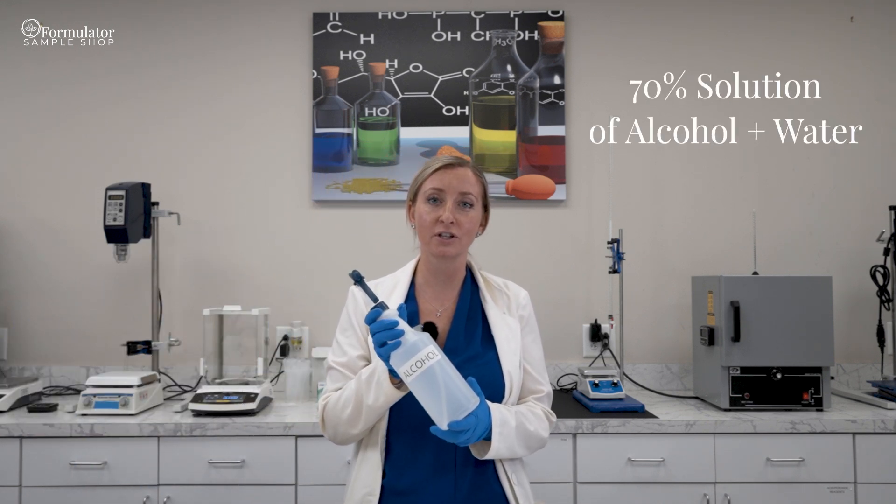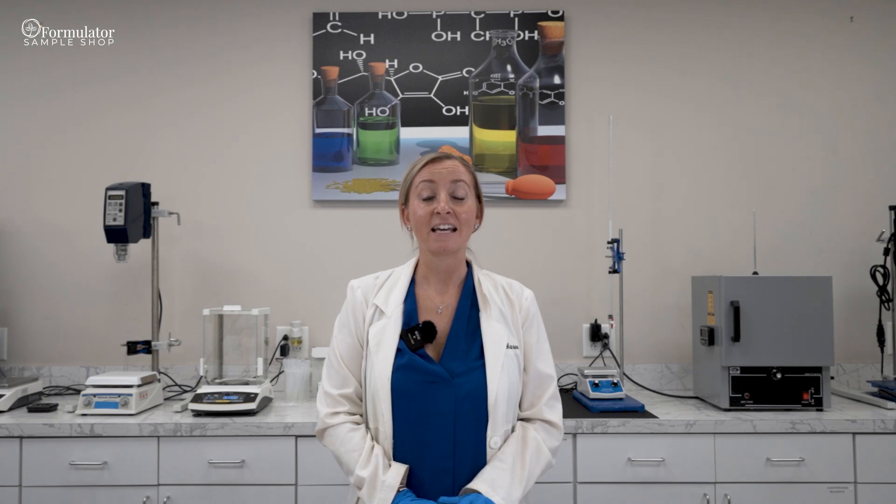We always start with alcohol, specifically a 70% solution of alcohol in water. It is important to sterilize all of your lab equipment and bench area because you want to avoid micro contamination. You don't want to send a product out to customers that has any risk of contamination from bugs or germs such as mold or bacteria. When you start with a clean space, that reduces your risk substantially.